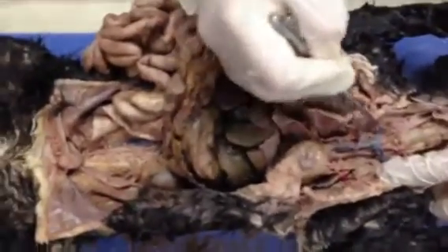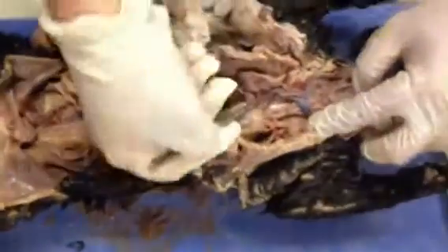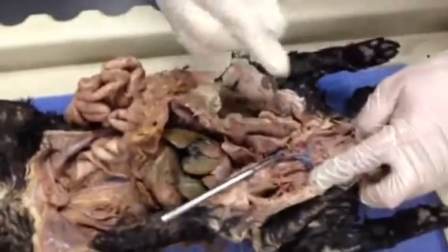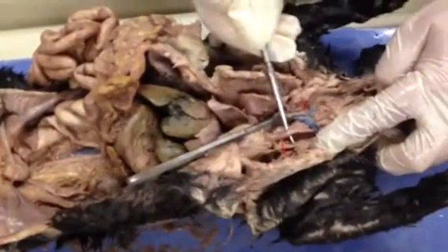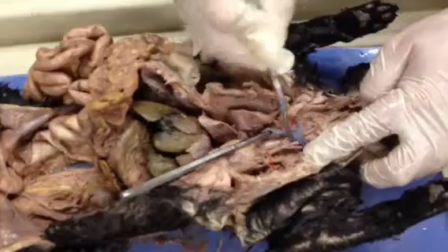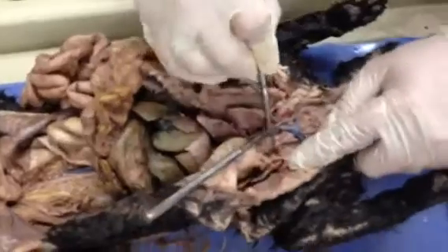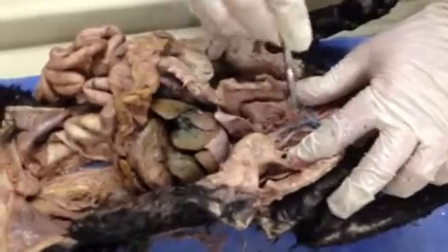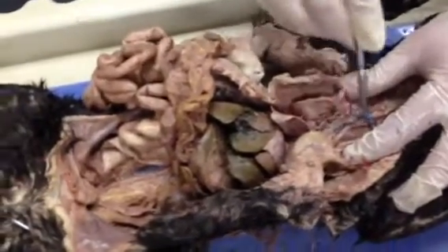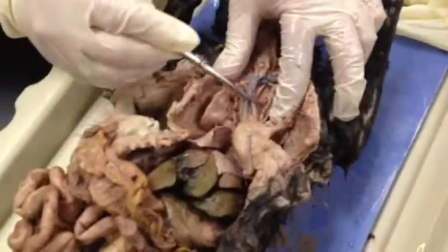These right here would be the left and the right brachiocephalic veins, which come together to form the superior vena cava. If we move them aside, we can see the brachiocephalic artery right here coming off of the first branch of the arch of the aorta, and this is going to branch off into the left common carotid, the right common carotid, and the right subclavian artery. The left subclavian artery would be the next branch off the arch of the aorta, which should be right here, which is right there. So this is the left subclavian artery right here, right next to the phrenic nerve.